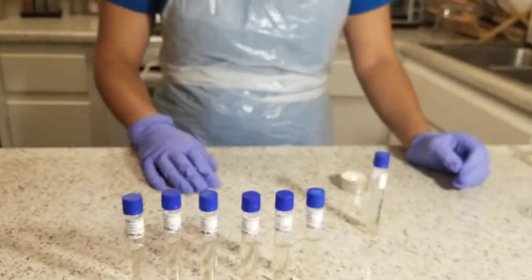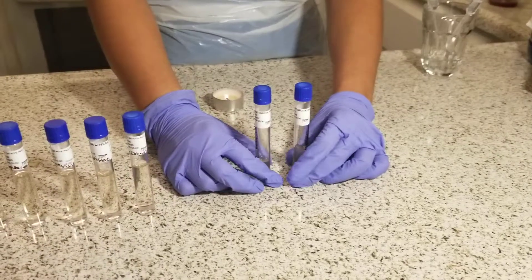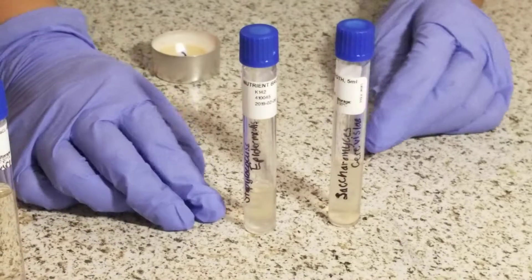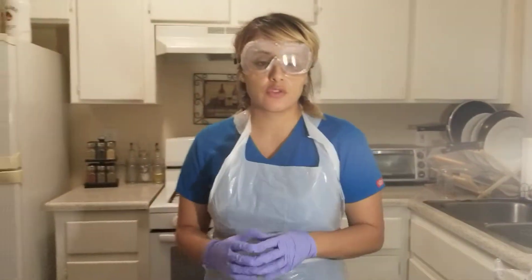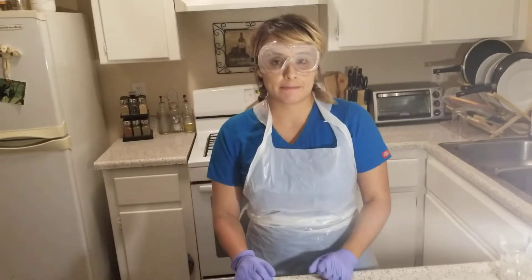I'll put my active culture broths back into the refrigerator for future experiments. That concludes the first experiment of lab week 6. Thank you.